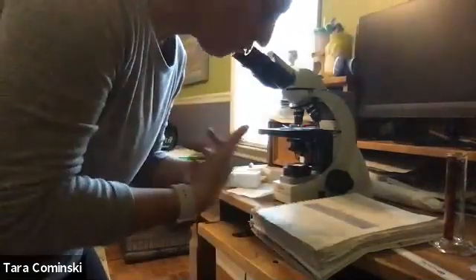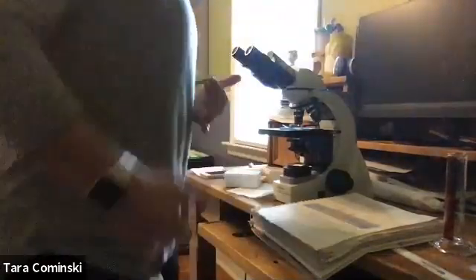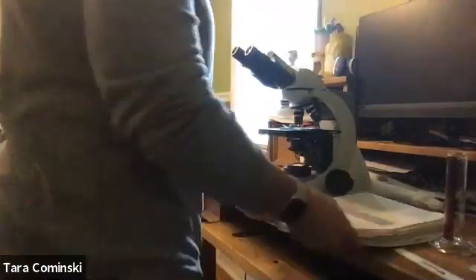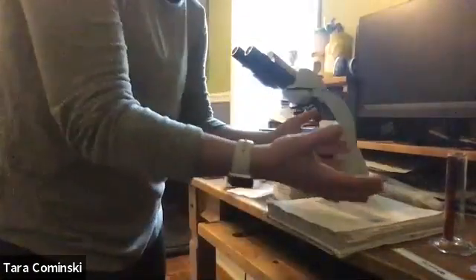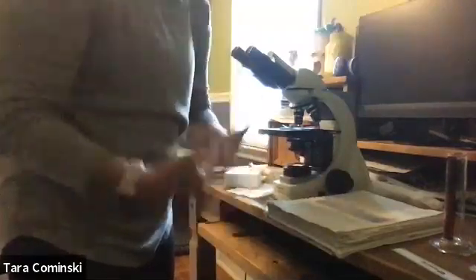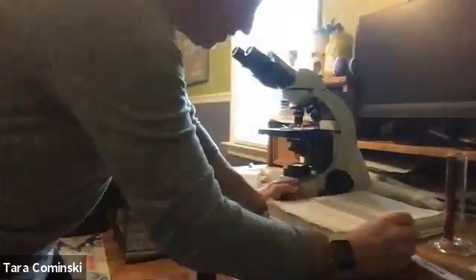Now, for the experimental procedure for weight on the bottom of page 11, I don't have a scale, okay? I didn't bring the scale home from the lab. And again, it doesn't matter. I'm gonna give you a weight. So in lab, we use scales, right, to get these weight measurements in grams or milligrams, all right? So I could just take my item, place it on the scale, and I can tell you how much it weighs.